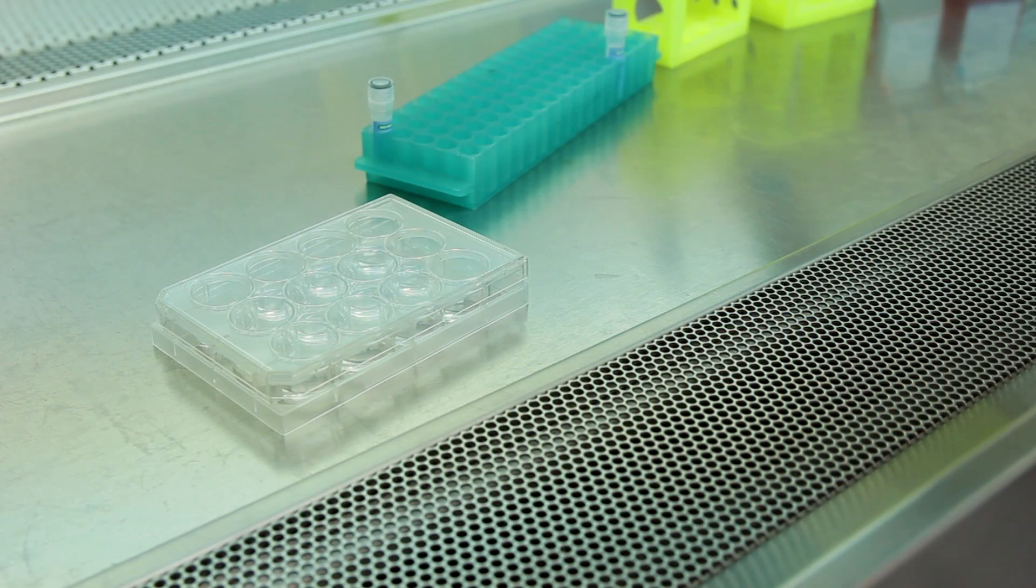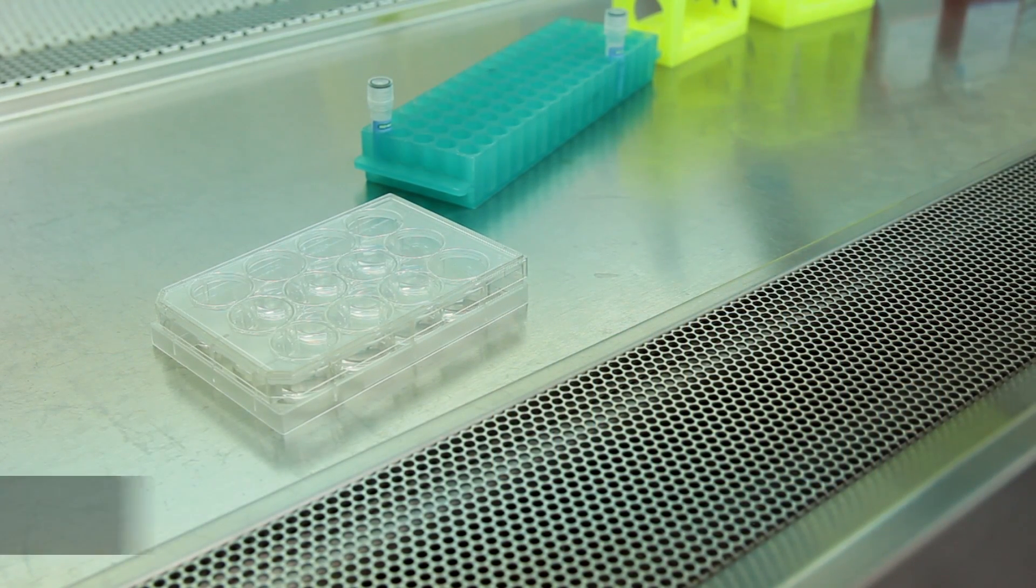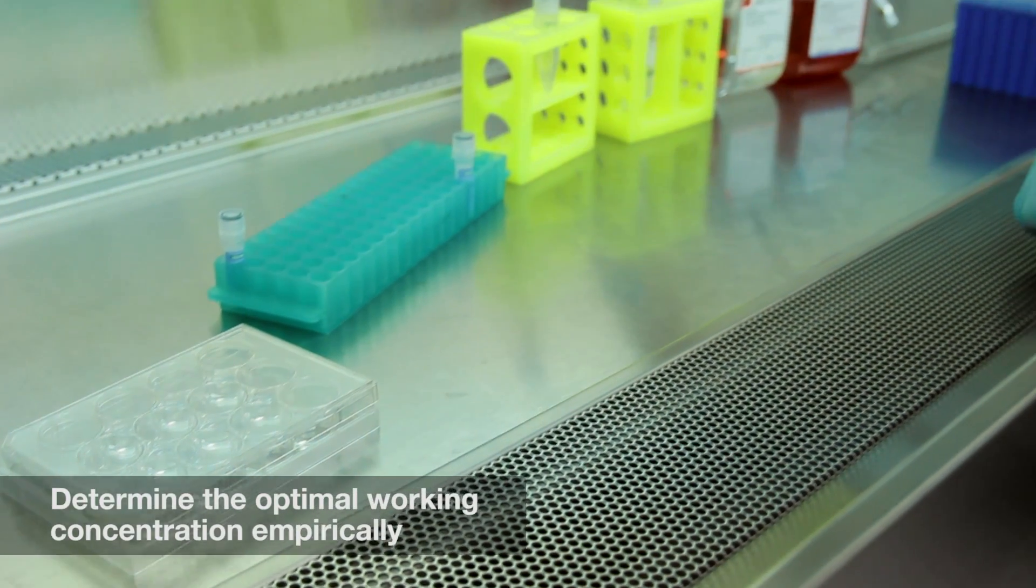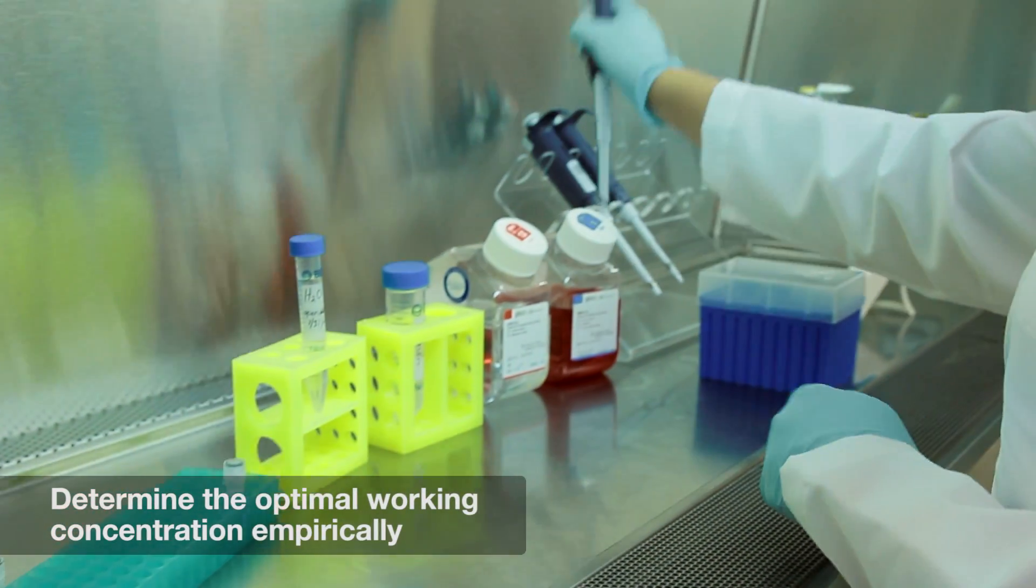These HeLa cells have been fixed with 3.7% formaldehyde at room temperature for 10 minutes and are now in PBS.